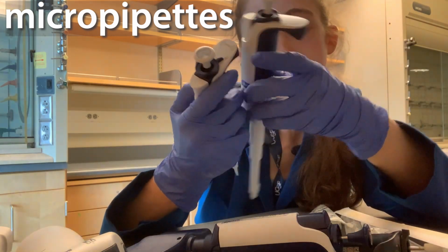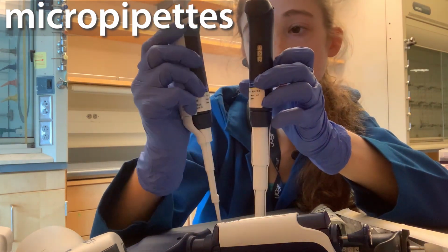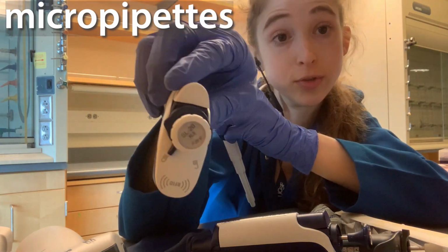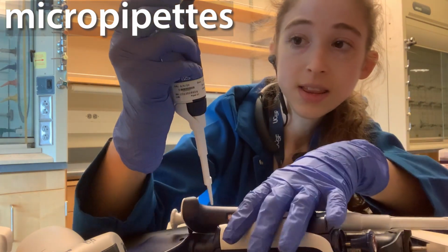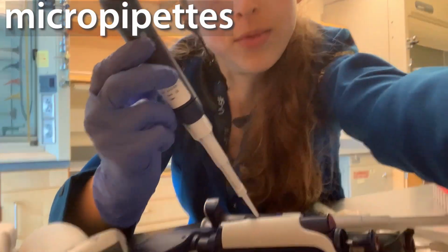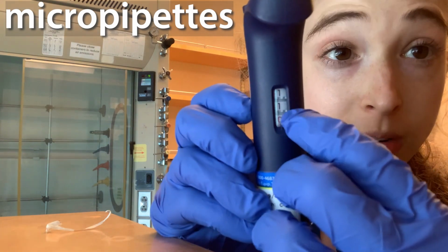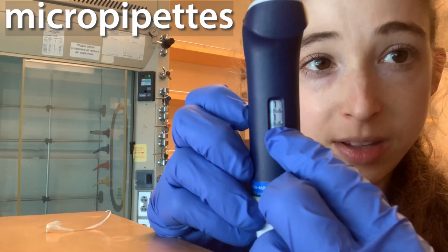If you look at one of these pipettes, you'll often see there'll be a line or there'll be different colors. So here they're different colors, and you can see this one. So this is the P20. It goes to 20 microliters, and from 2 to 20 microliters. If you look over here, you can see that it's set to 11. So it's set to 11, and then you see this red, the 0 is in red. This is telling me that this is 11, and the red is after the decimal point.